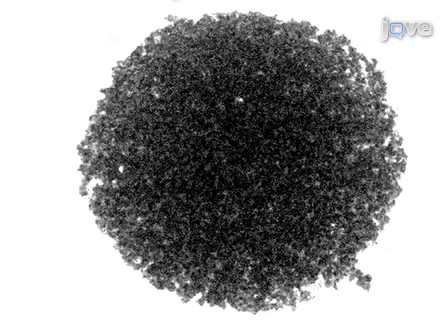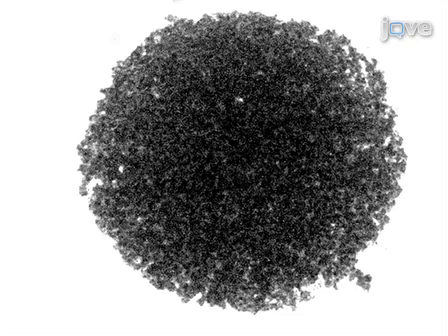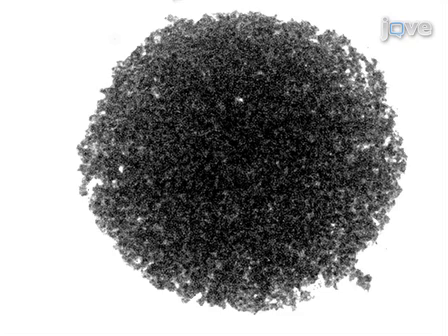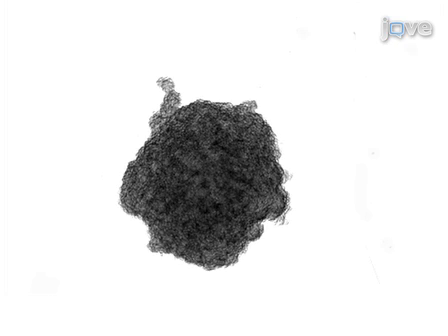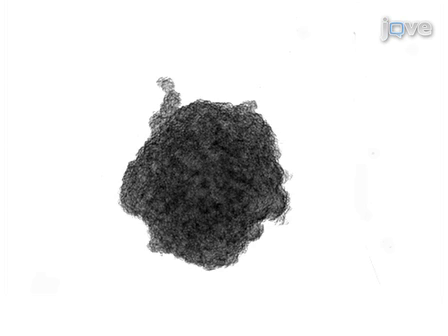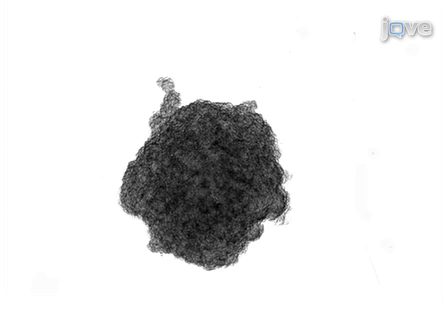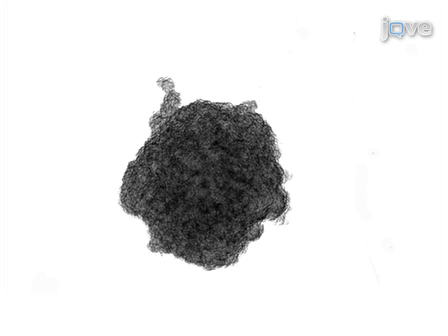This brightfield microscope image demonstrates the aggregation of rat prostate cancer MLL cells after 18 hours of incubation using the hanging drop method. A second aggregate of MLL cells formed after 18 hours shows the effect of culturing in the presence of 25 micromolar of the MEK inhibitor PD98059, resulting in a substantially more compact aggregate of cells.